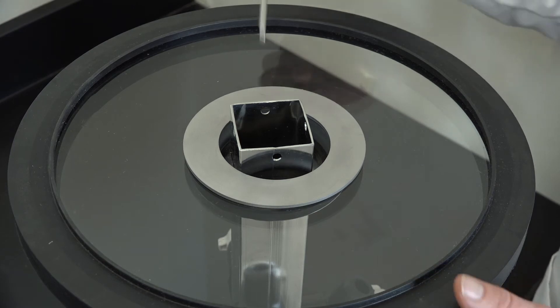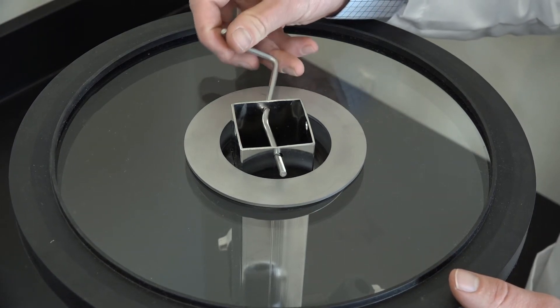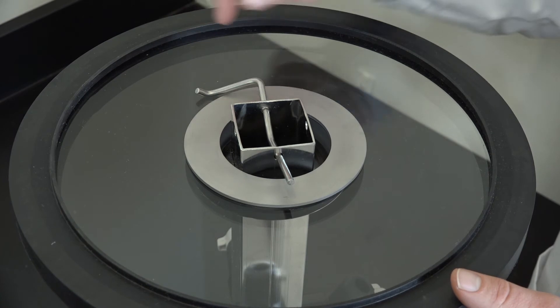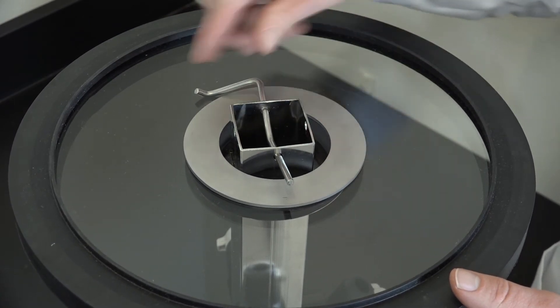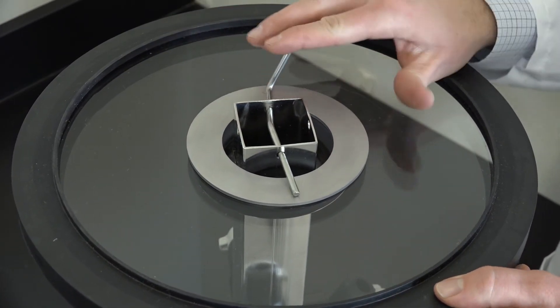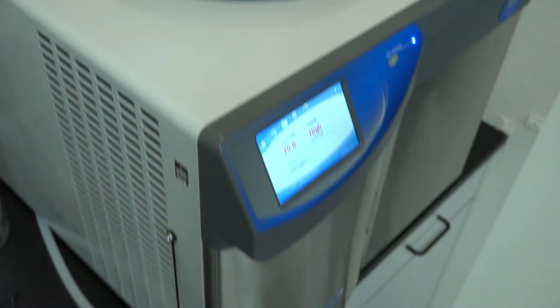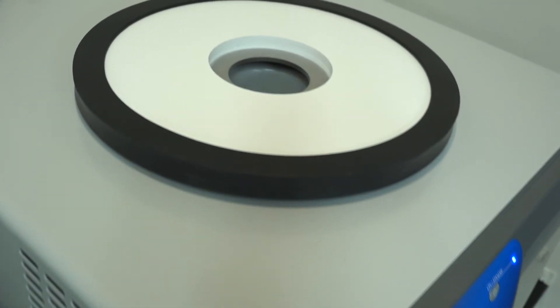Slide the latch pin through the lower set of holes in the manifold until the bend of the latching pin is in the middle of the hole. Don't push the pin in all the way. Now turn the pin so the assembly is latched.